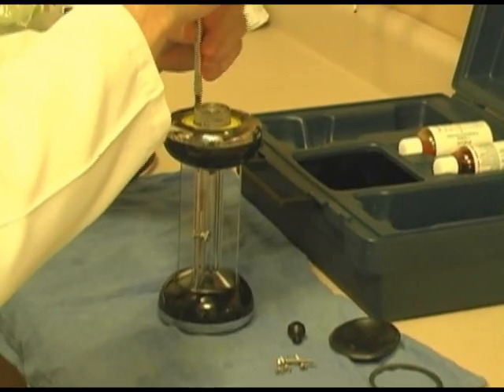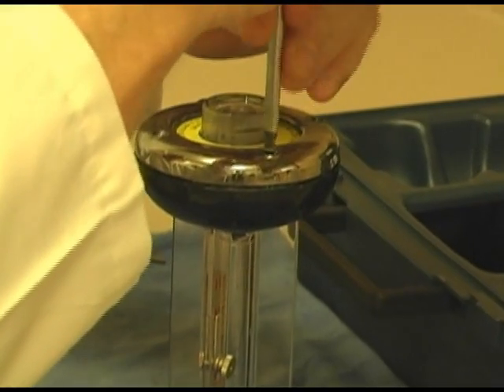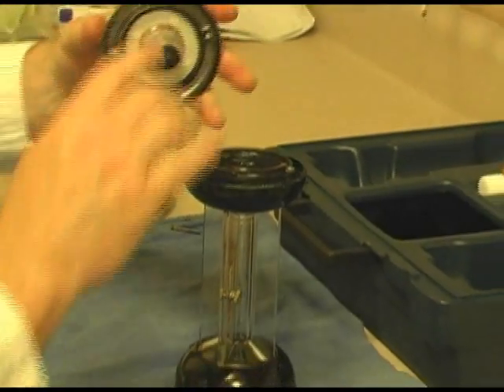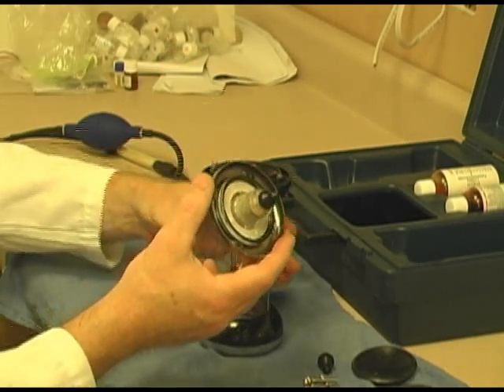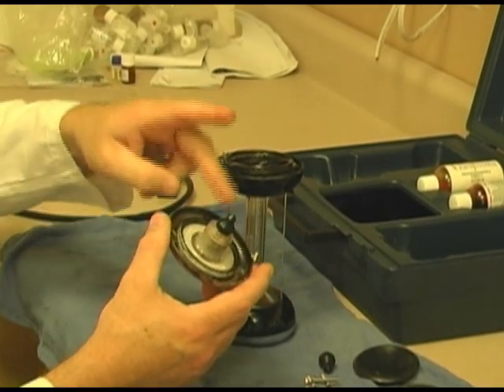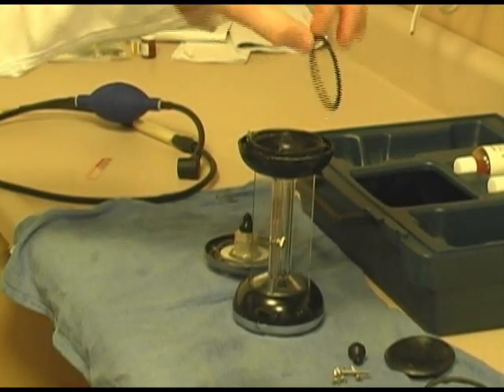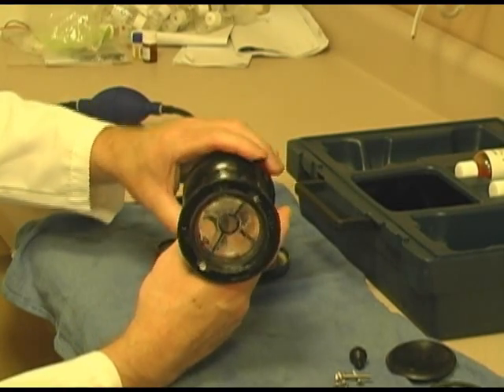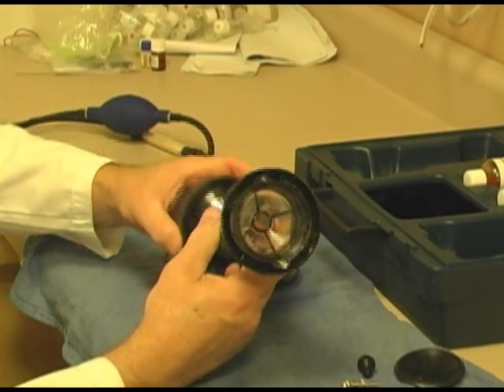And of course, I've already had this removed, so for me, it's only going to be 2. And it is off. Inside you see this rubber plunger, which we're going to replace. That is the piece that if you keep this stored downward, that's going to get all eaten up and start leaking. You'll see black little pieces of rubber in your Fyrite solution. Well, we're going to be replacing that. And this is the inner gasket. We're going to be replacing that. And of course, that's the inside, and you can see there's nothing really technical about this. It's just a glass cylinder, and we're going to clean that up.